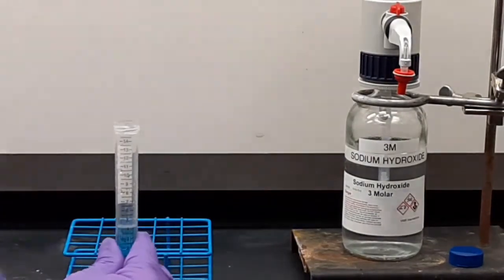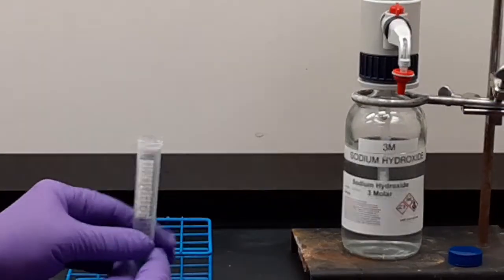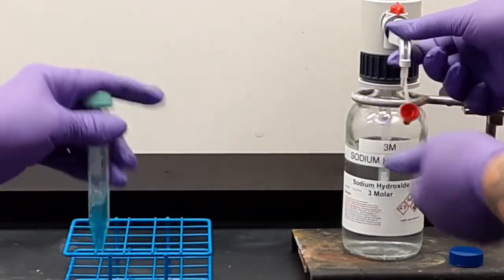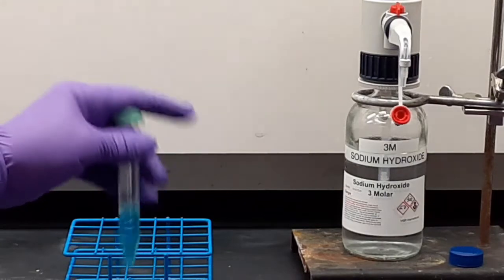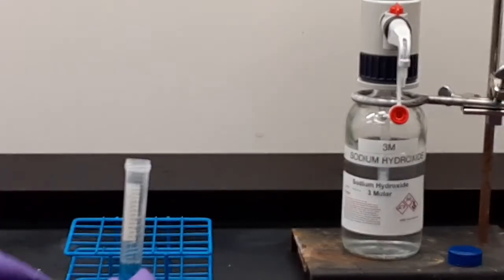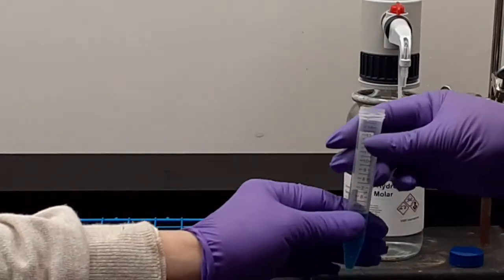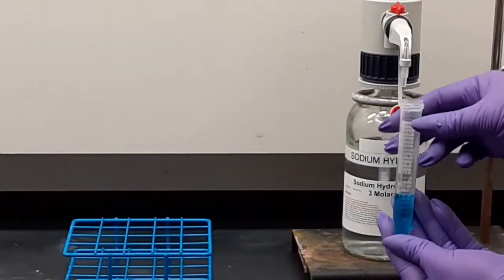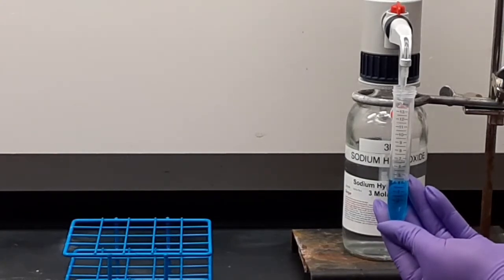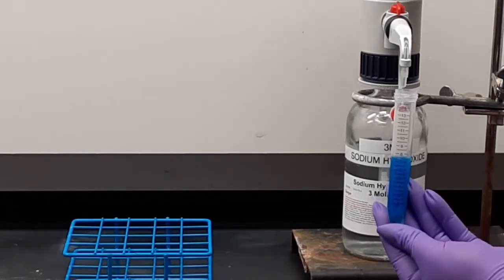Likewise, the dispenser will be ready for you to use, so you won't have to open it or turn on the valve. Notice I'm shaking the tube there. Agitate it well. Take the cap back off. 1 aliquot. Everything is set up for 1 pump on this experiment.